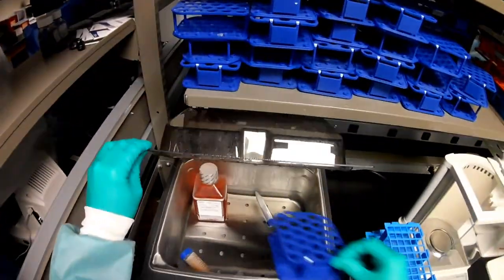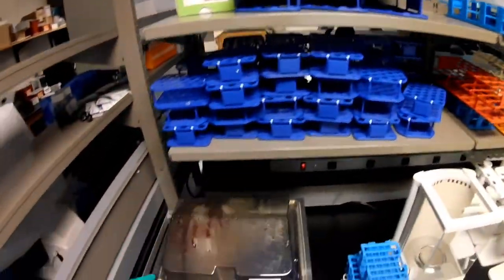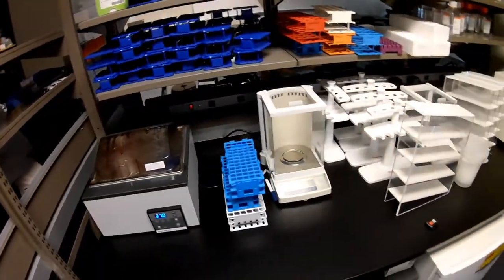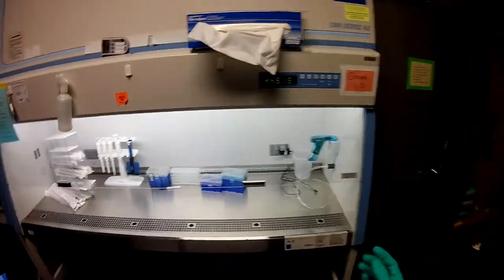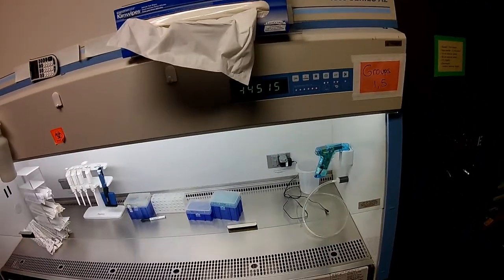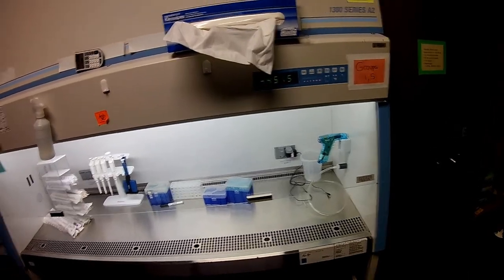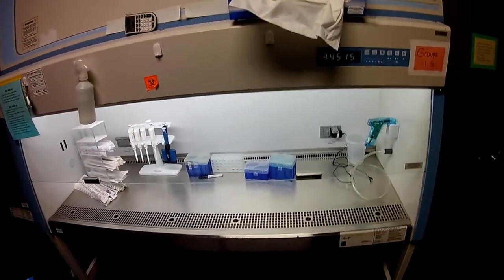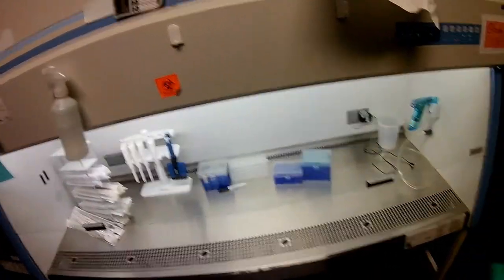Usually I have some sort of rack in here, but it doesn't really matter too much. Let's put this in here. And so while we're waiting for all that, we'll be waiting for this as well, and we'll see that that light will eventually turn. And so the first step in the process is to spray things down with ethanol.